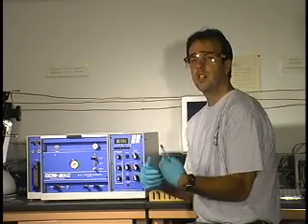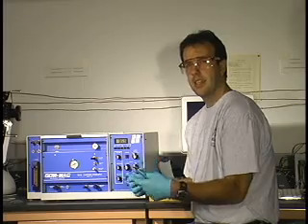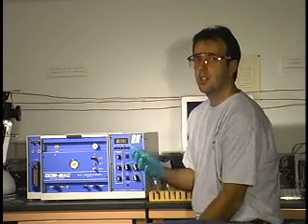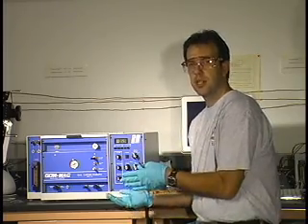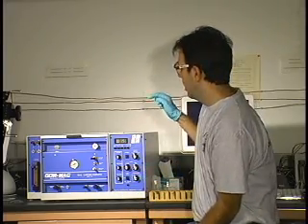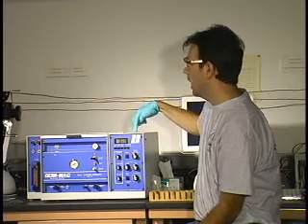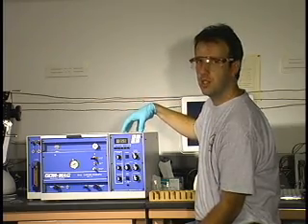While your alcohols are separating and your chromatogram is running, you should take this time to record the data you need for this lab. There are several pieces of data you're going to need to record so that the experiment is reproducible. The GC number is listed on top of the instrument, as well as the type of column that we're using, so you need to record both of those pieces of information.